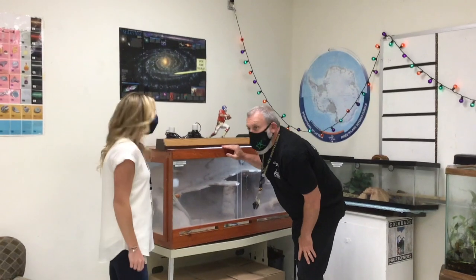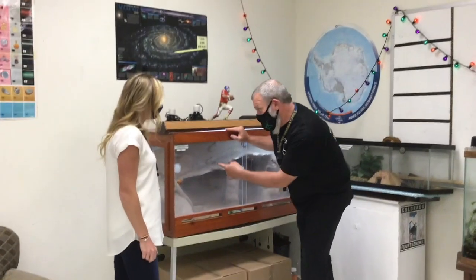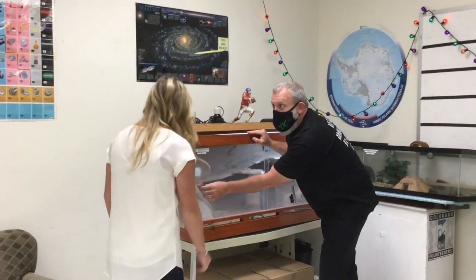Go. Hey! You want to get Rose out? Look, she's right there. Totally. We just opened up this door and we can get her out. Can you do it? Let's get her out. Yeah.